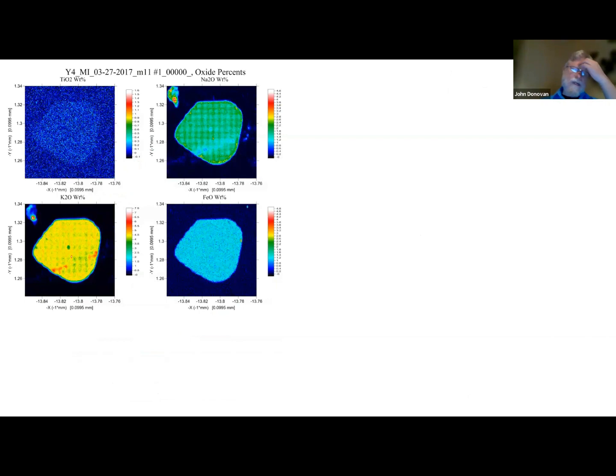Okay, and so here's an example of where we're doing a quantitative map of a melt inclusion in quartz. And there's a couple of things you'll notice here. One thing that I found fascinating is that you see that kind of grid pattern here in the sodium, and you can see it a little bit in the potassium here. That is an artifact of ion migration in the sample. And what we think is happening, because the beam is not stepping across the sample, the beam is smoothly going across the sample. You know, it's continuously moving.